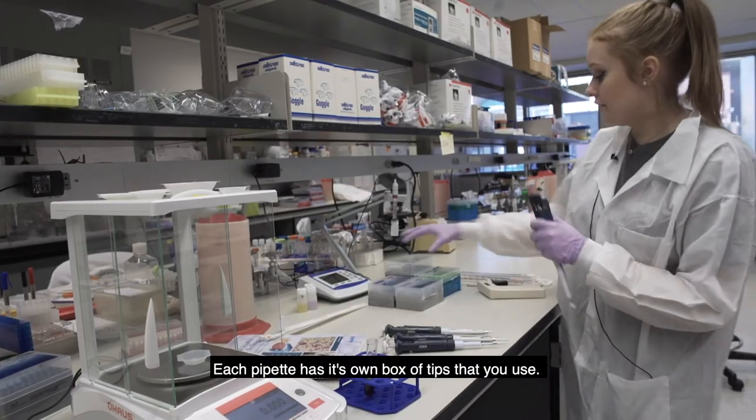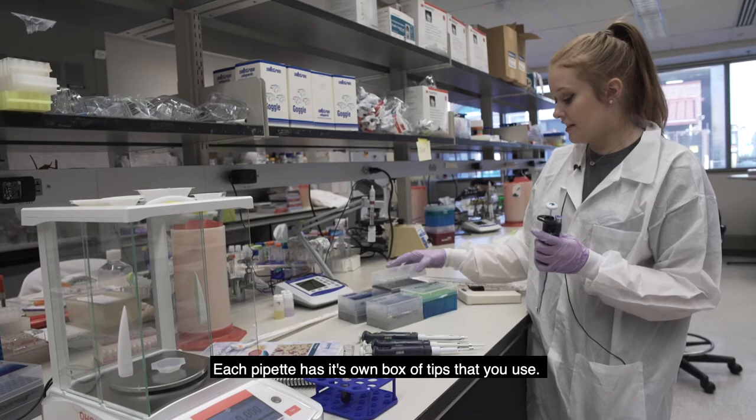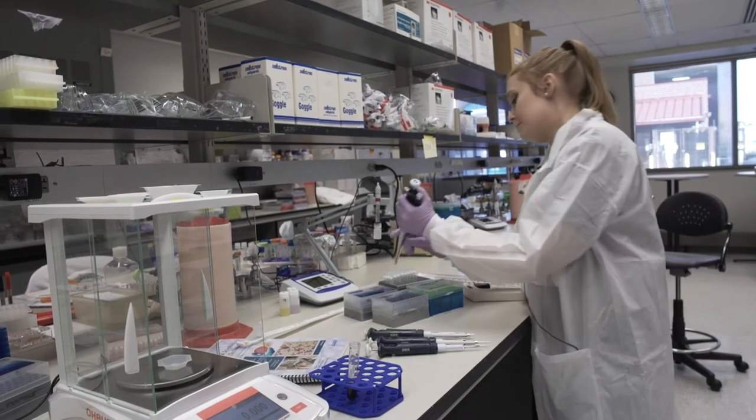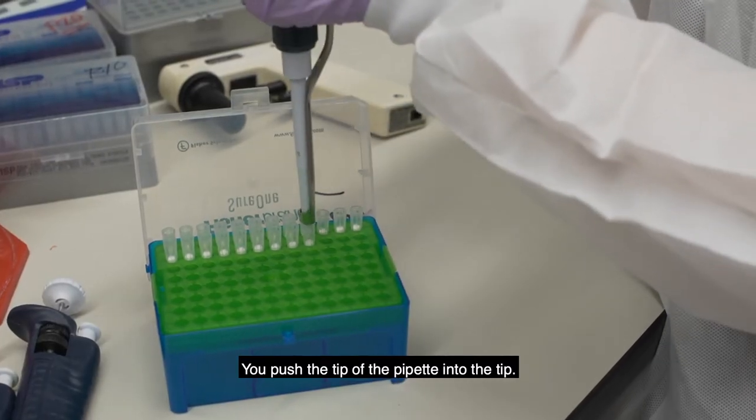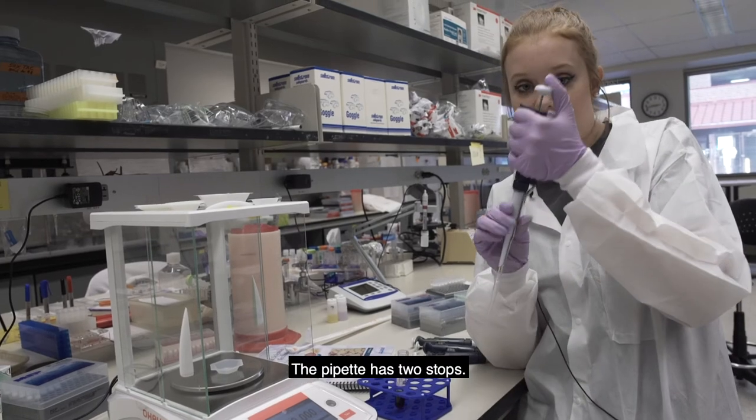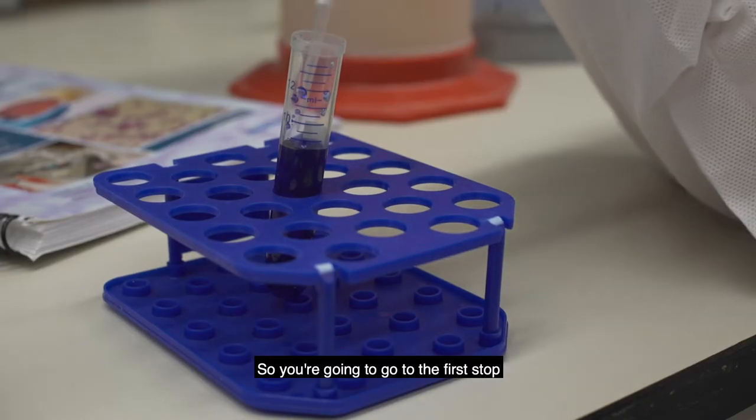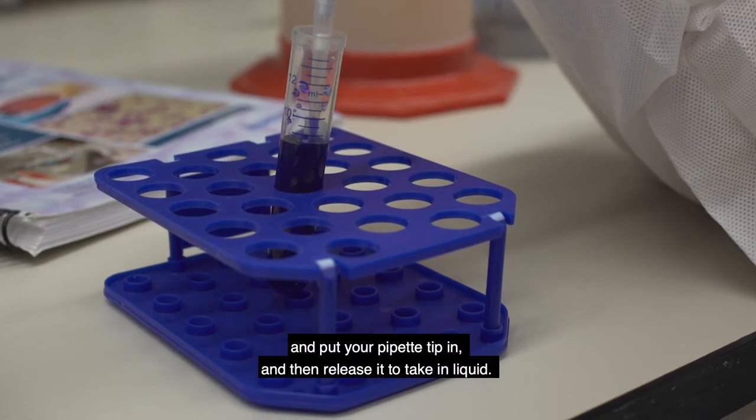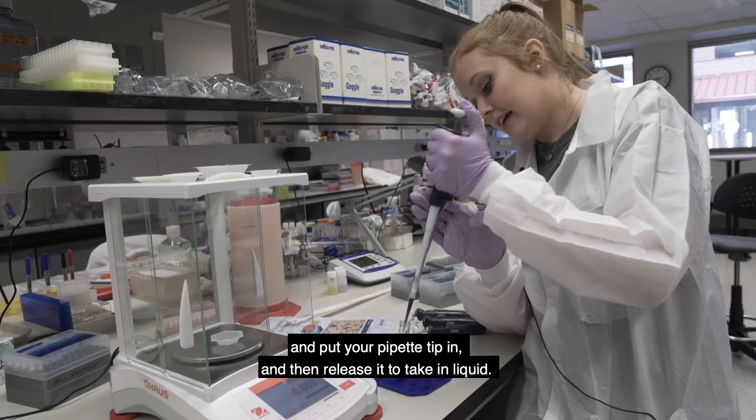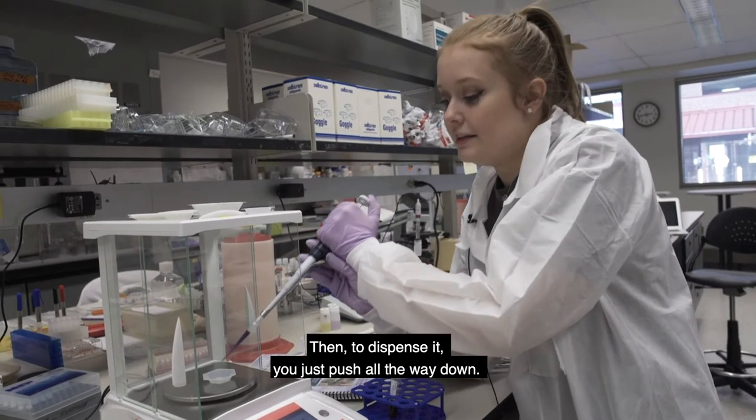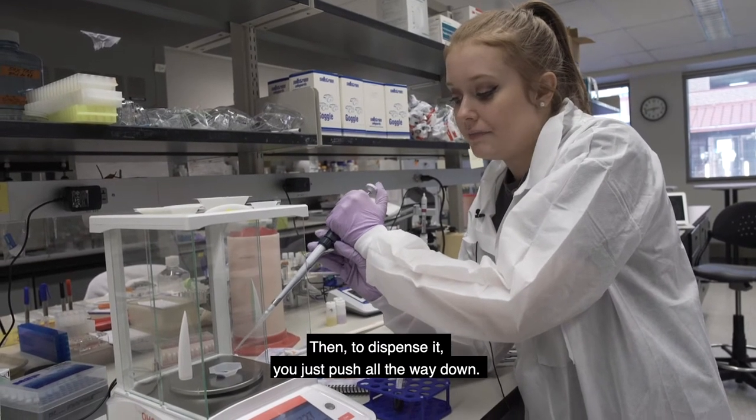And then each pipette has its own box of tips that you use. So you just push the tip of the pipette into the tip. The pipette has two stops. So you're going to go to the first stop and put your pipette tip in and then release it to take in liquid and then to dispense it, you just push all the way down.